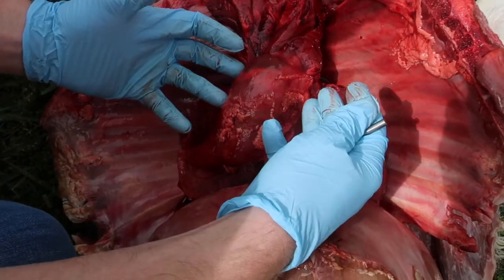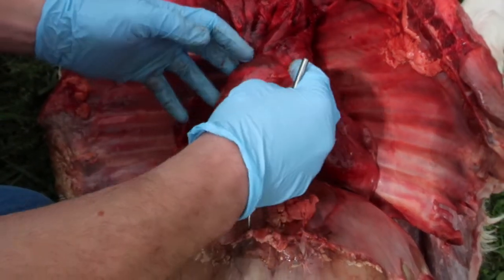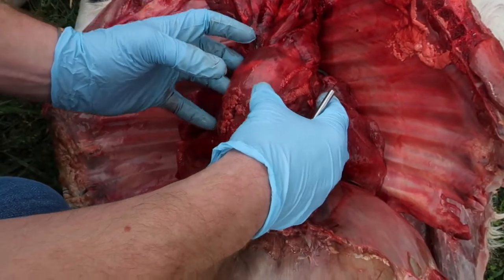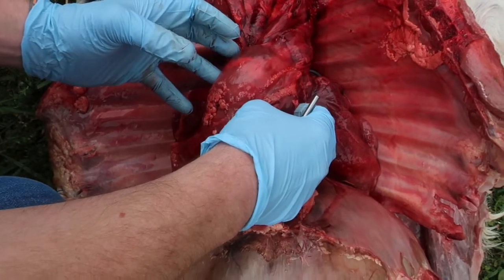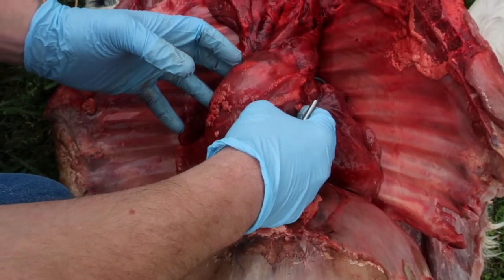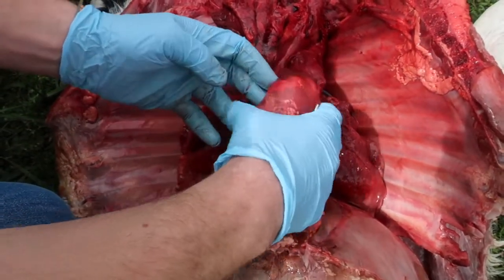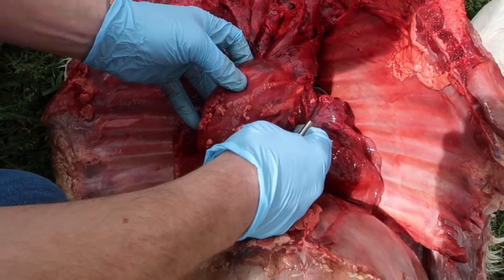So when blood enters the right side of the heart, it's going to go into the right atrium. It's going to then flow into the right ventricle, and then the heart's going to contract and push that blood into the lungs. And that's going to enter into the lungs through a pulmonary artery. Once that blood has re-oxygenated, it's going to return to the left side of the heart, and it's going to enter into the left atrium, the left ventricle.